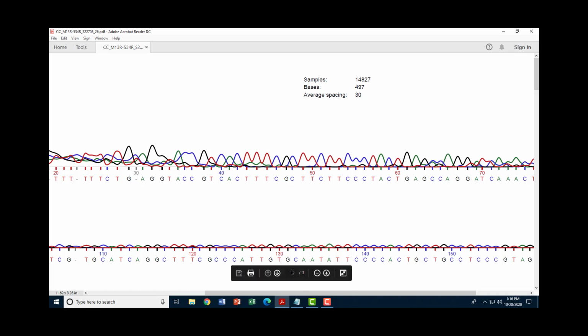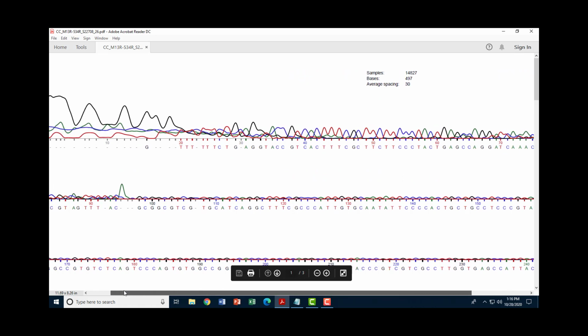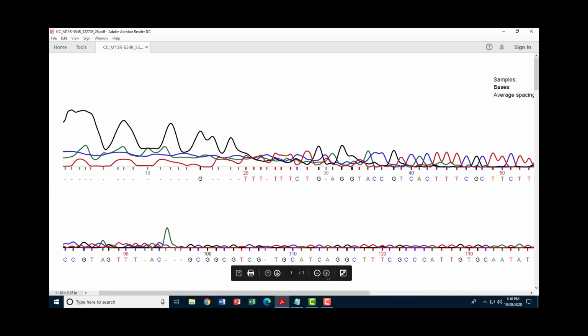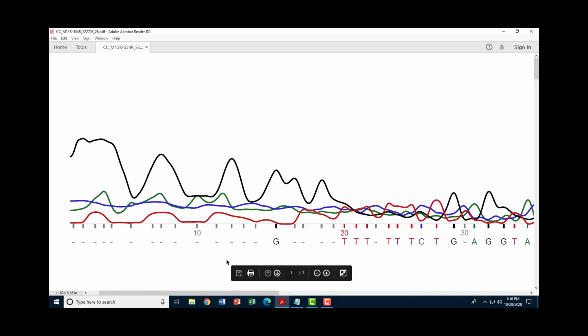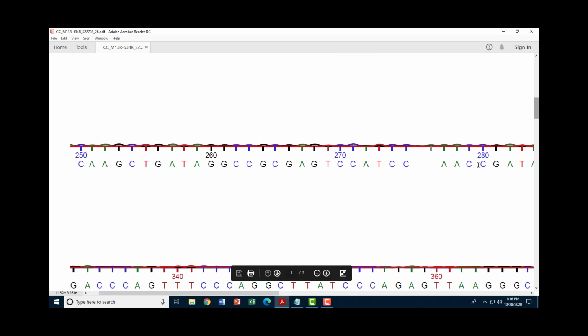But every once in a while, it'll fall into a place where it just can't figure out what that particular base is based on the waveform reading. And we'll look at that here. Right here. At position 271, 2, 3, 4, 5, 6, it couldn't determine what this base is. And so it put an N in your text file for your sequence.